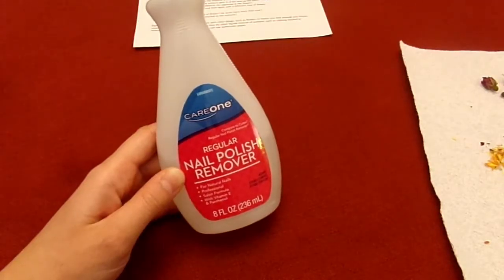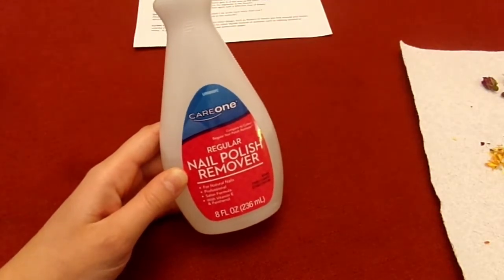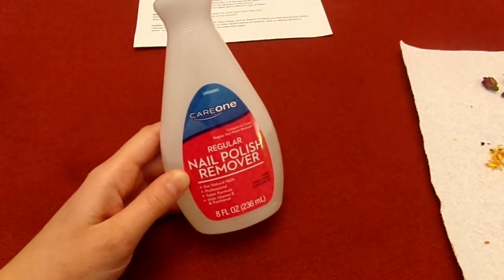When you work with acetone or nail polish remover, make sure that you're in a well-ventilated area and that you're away from all flames.